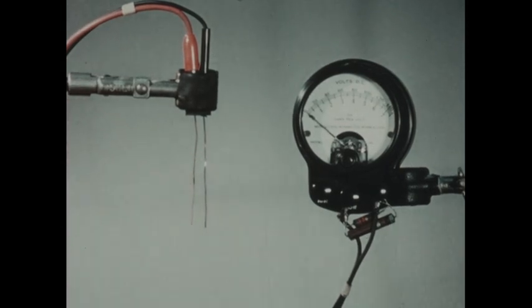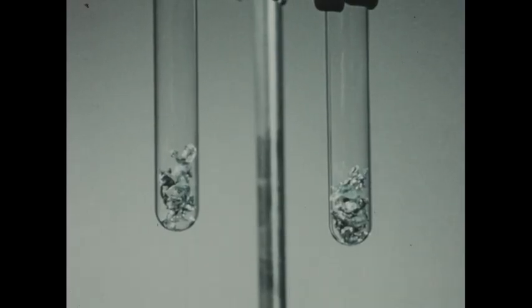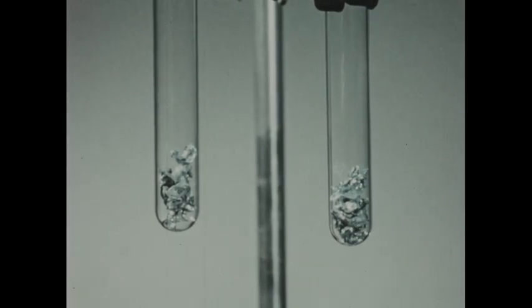Now we'll compare the rates of reaction of these two acids with zinc. We saw previously that solutions of hydrochloric acid in water were much better conductors than were solutions of acetic acid. Now when acids react with active metals, such as zinc, the reaction is actually between the hydrogen ion and the zinc. And therefore, solutions which are more highly ionized should have a higher concentration of hydrogen ion in their solutions. This means that hydrochloric acid should react with zinc more rapidly than acetic acid. And we can test this prediction by experiment.